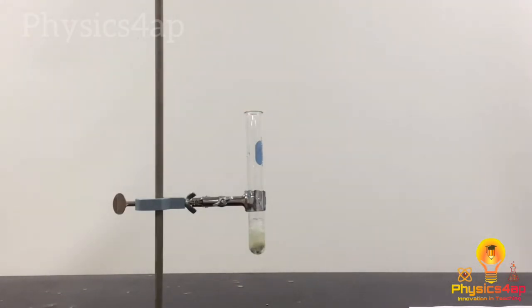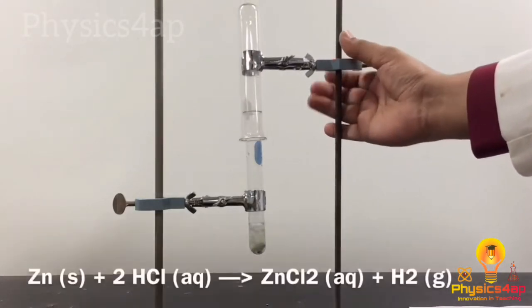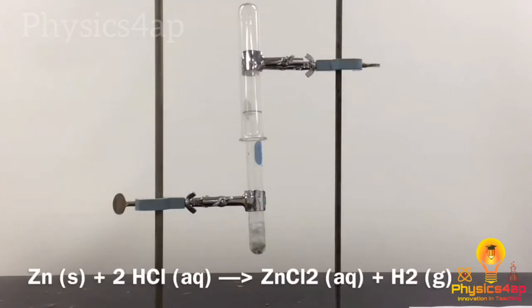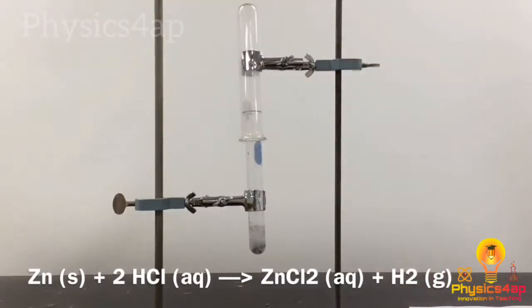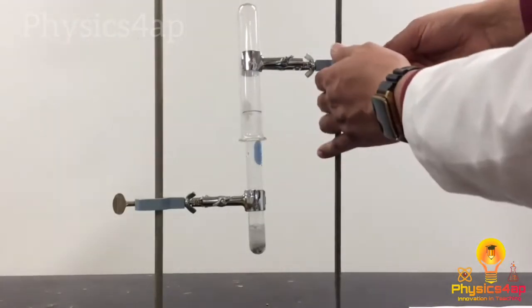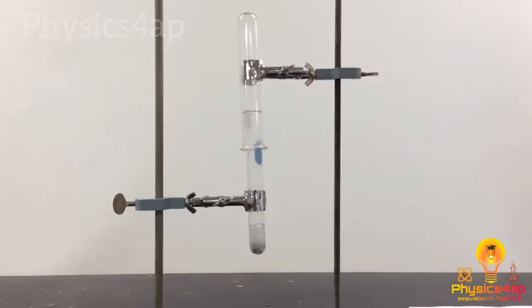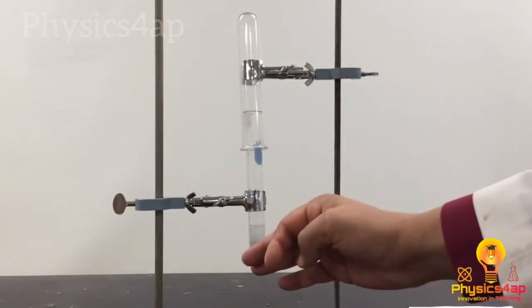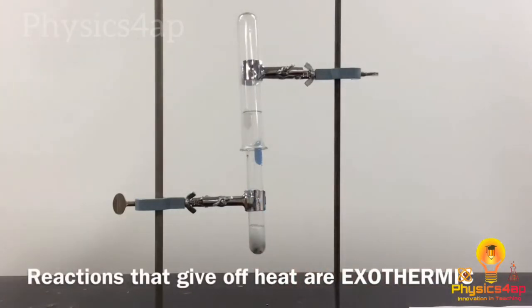Now those are bubbles of hydrogen gas. I'm making quite a bit of hydrogen gas here. So I'm going to put this other test tube on top so I can collect as much of that hydrogen gas as possible. And since hydrogen is less dense than air, most of that hydrogen should stay in the test tube. If I touch this, I can feel that the test tube is getting very warm. In fact, it's quite hot. So this is an exothermic reaction.